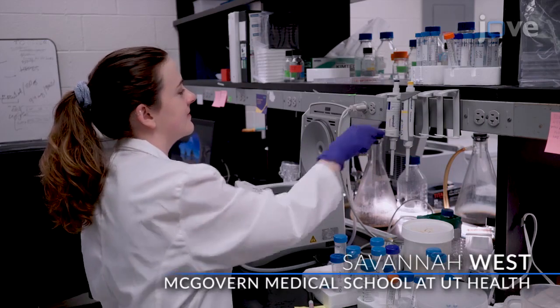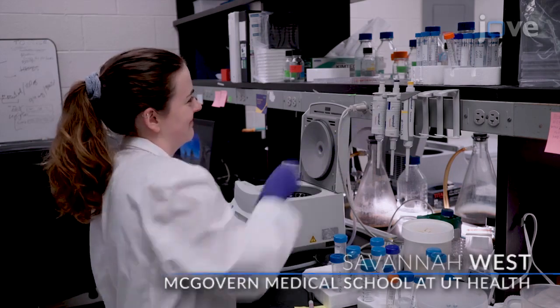Demonstrating the procedure will be Savannah West, a graduate student from our laboratory.